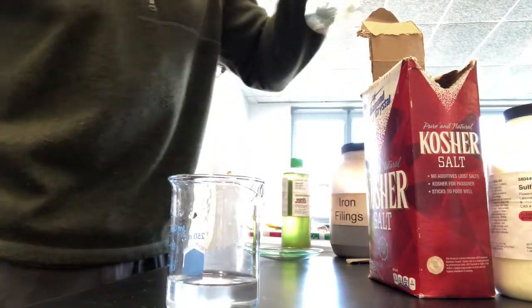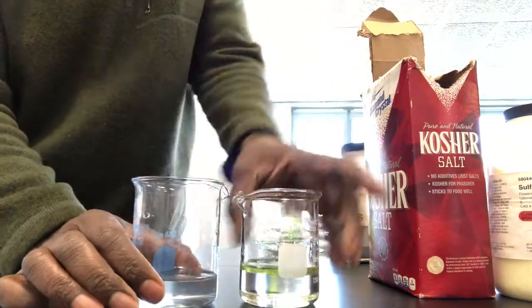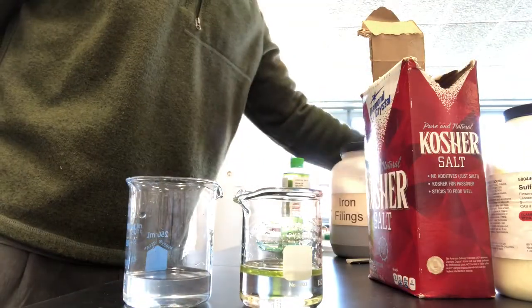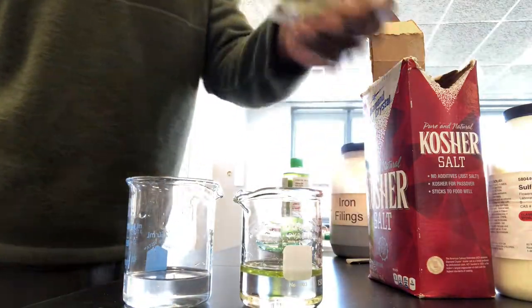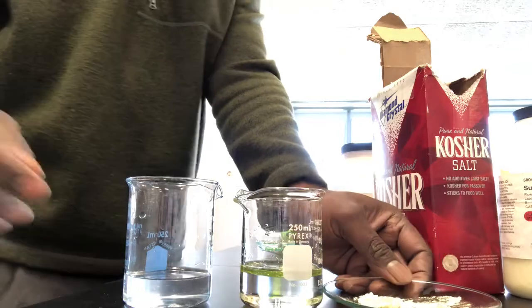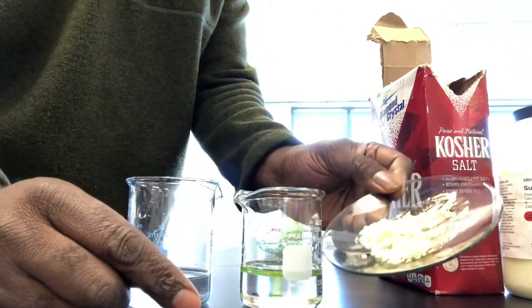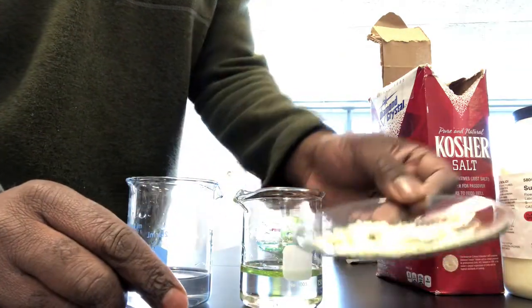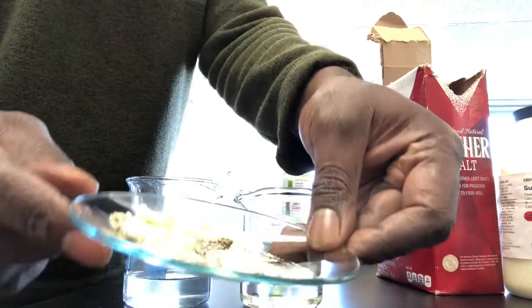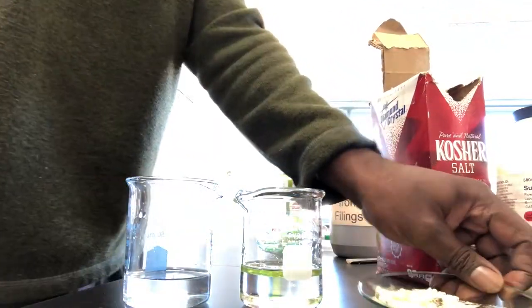We have a heterogeneous mixture here with the oil and water. We have a heterogeneous mixture here with the sulfur and the iron filings. So that's heterogeneous. All righty.